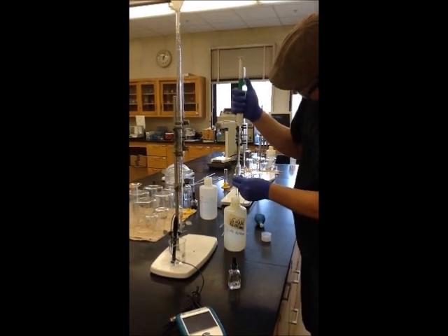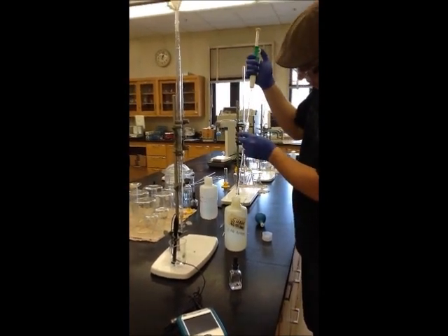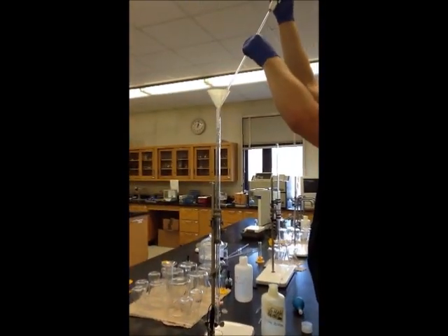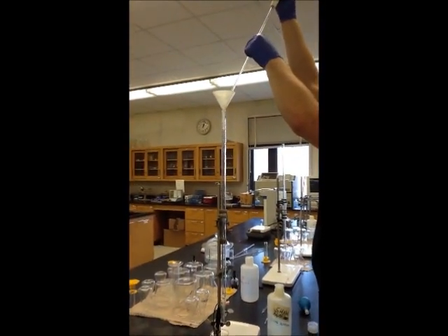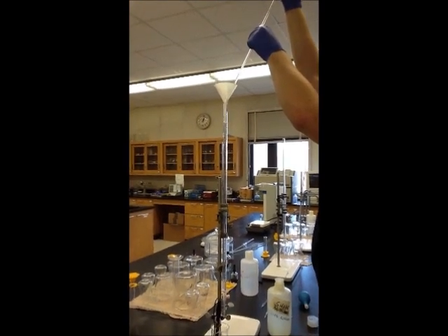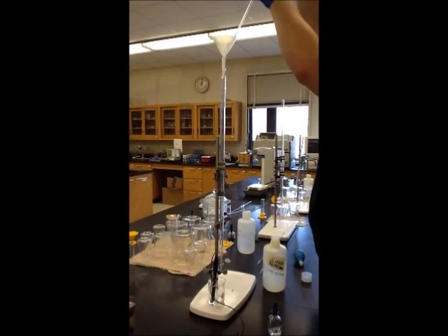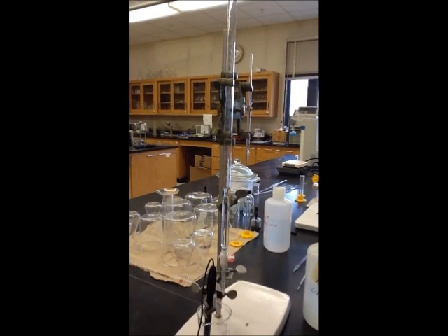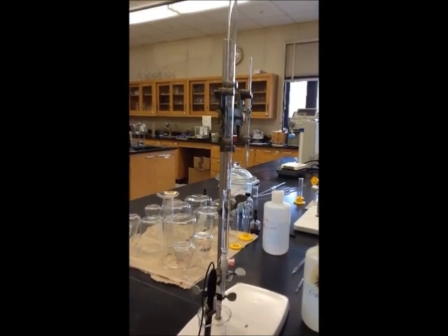Using this volumetric pipette to avoid splashing, we place the sodium hydroxide in the top of the burette using a funnel. And we'll repeat this several times until it's full.